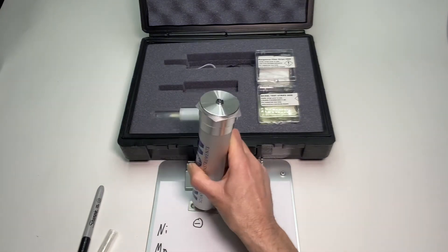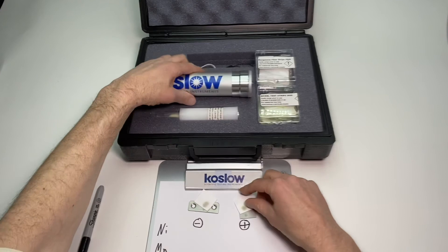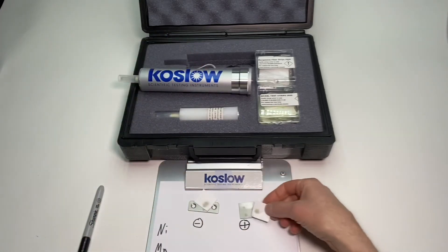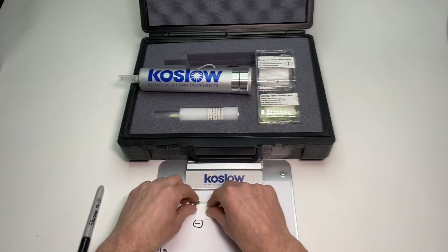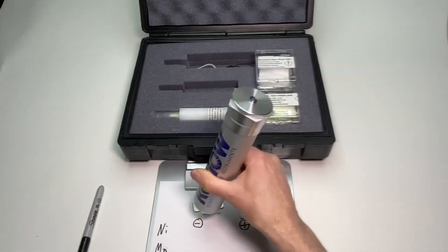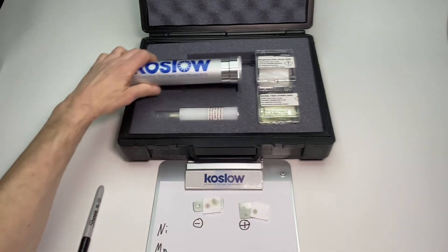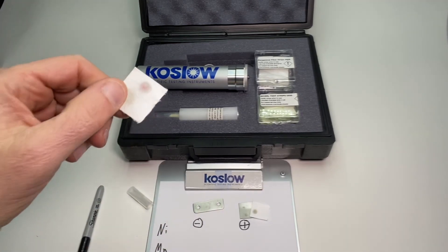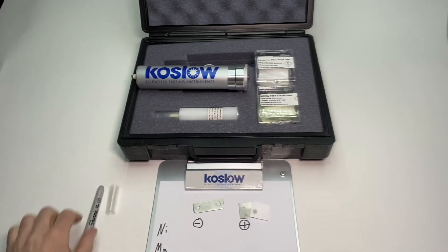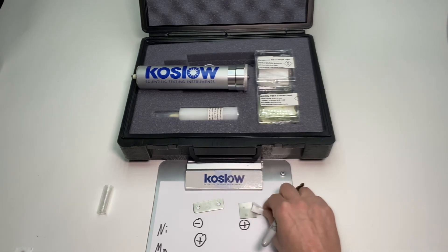You have to get that blue light to stay on. The first sample gives a negative result. The second result looks a bit weak at first, so I try it a couple more times to make sure I'm aligning it well. We get a really good pink colored spot — a clear positive result.